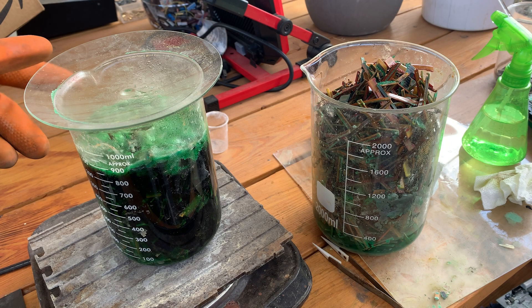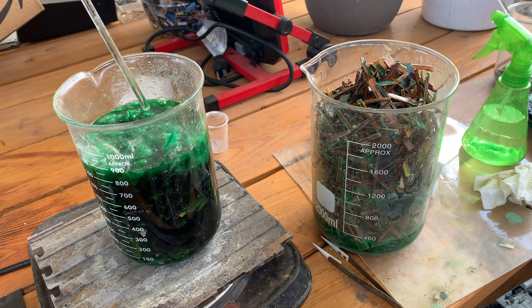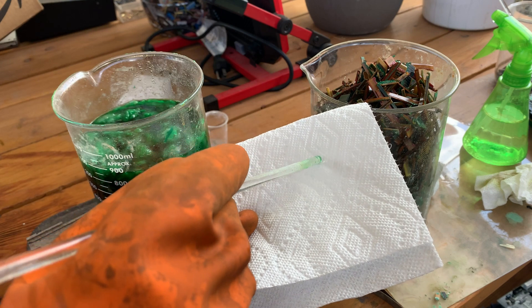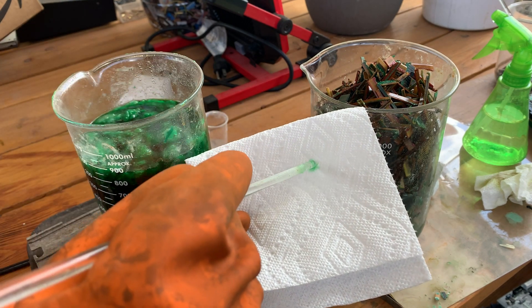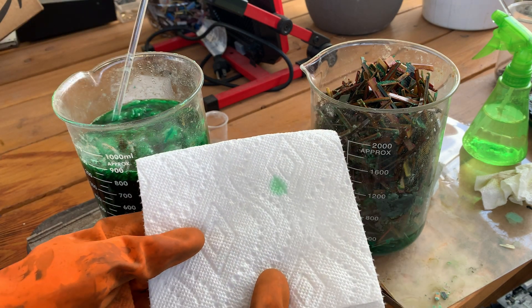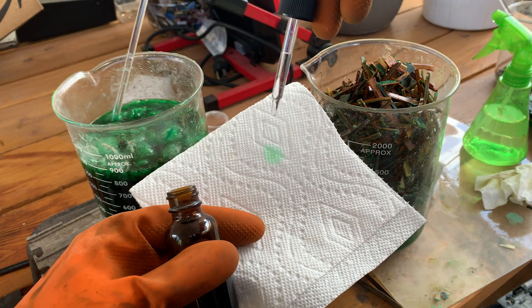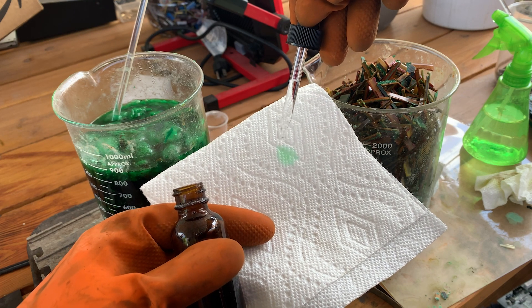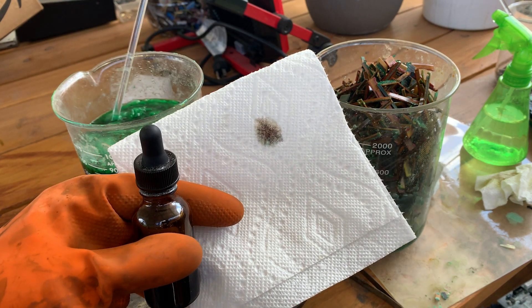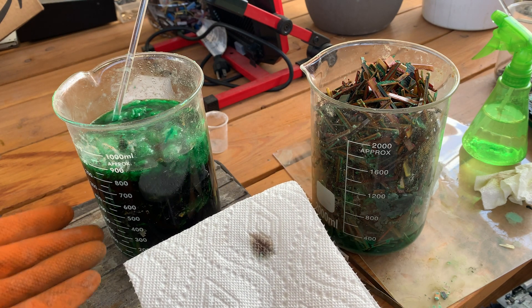This is our last of the multiple batches that I ran with the fingers. I didn't want to use a whole lot of acid. Let's do a quick stannous chloride test off of this solution — put a drop right there. This green color tells me there's a lot of copper still in our solution, so this isn't going to be very pure. We'll have to do a few refinements. That is indeed a very positive reaction — we have gold mixed with our copper, unfortunately, in our aqua regia.